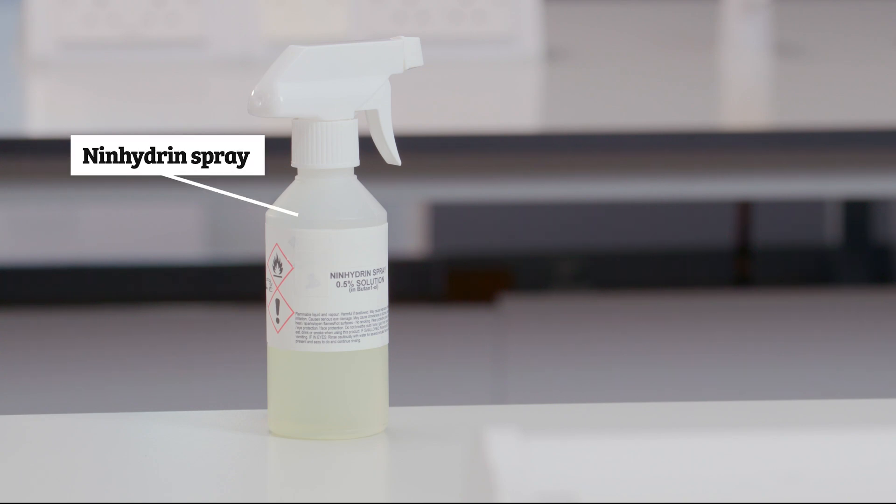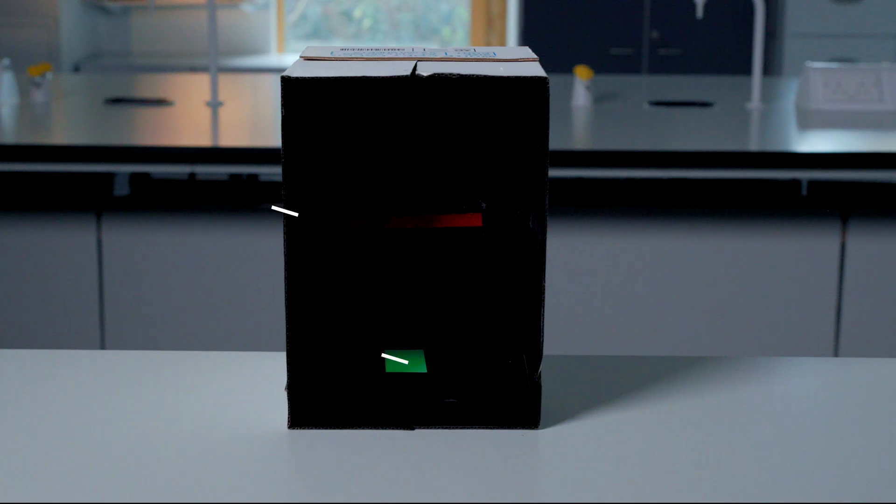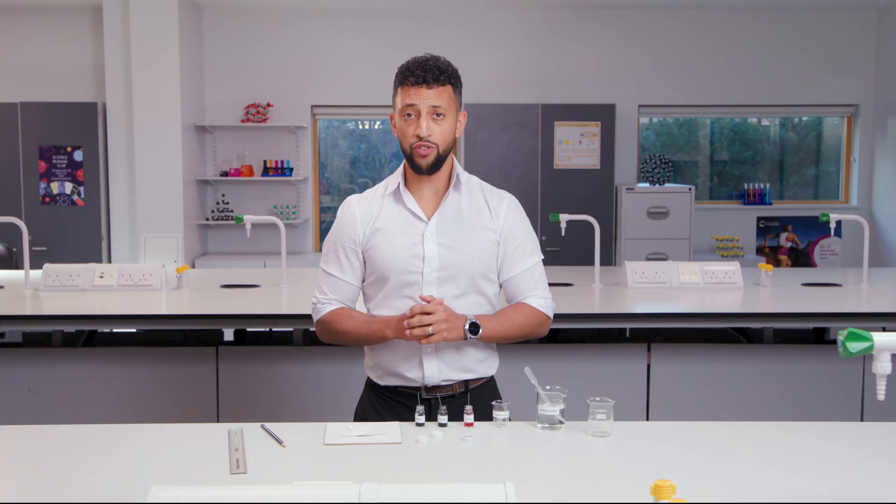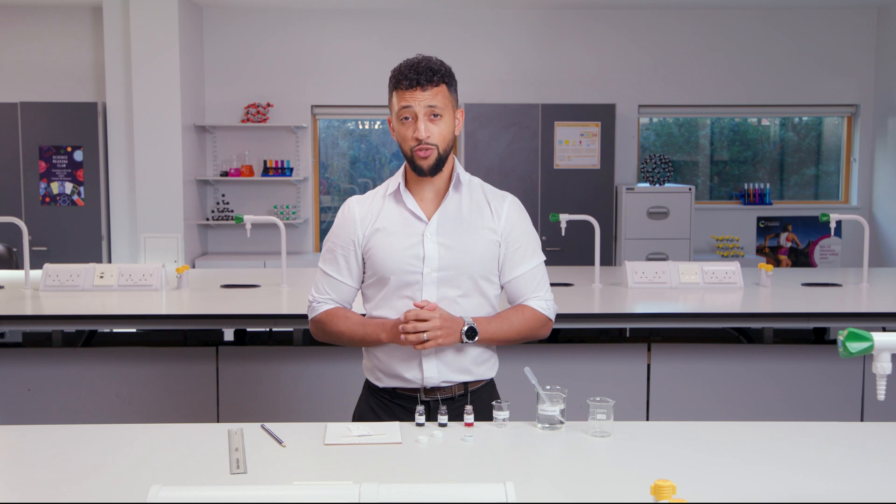When you can't see the results, you can use an ninhydrin spray or UV light to make them visible. Scientific researchers often use TLC plates rather than the chromatography paper that I used today.